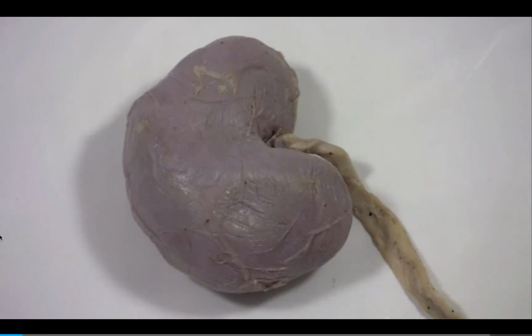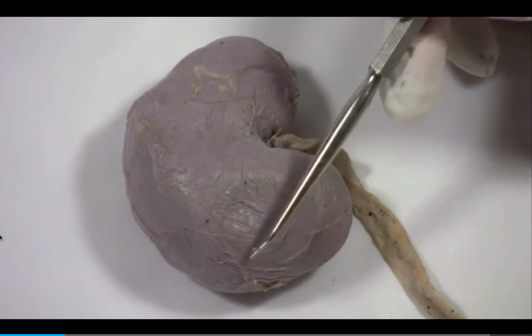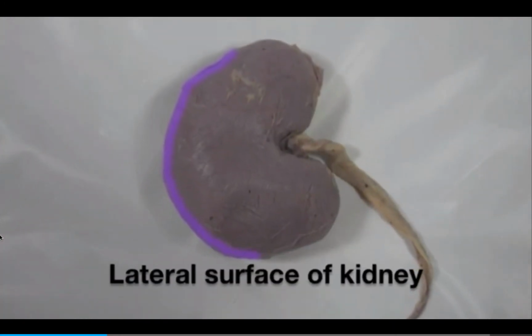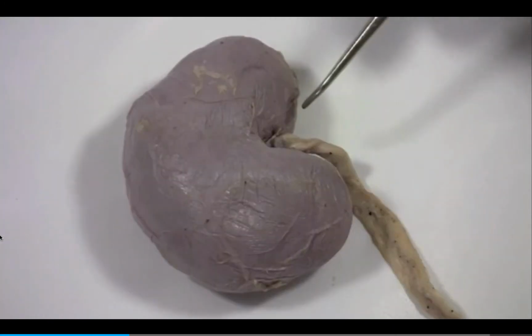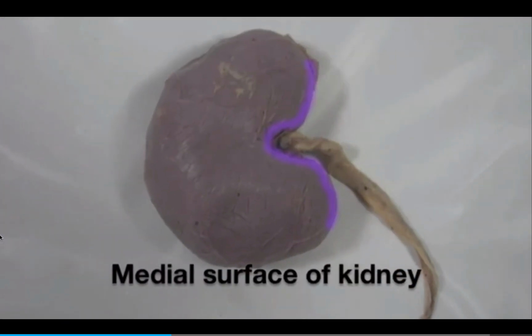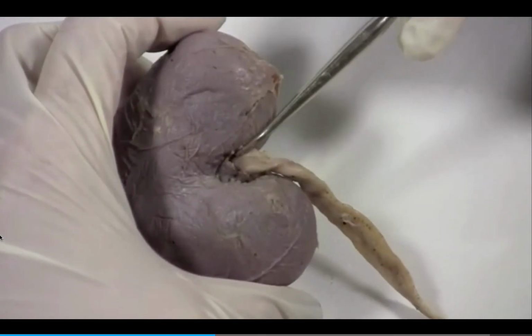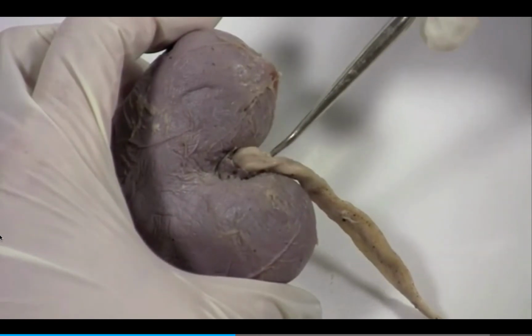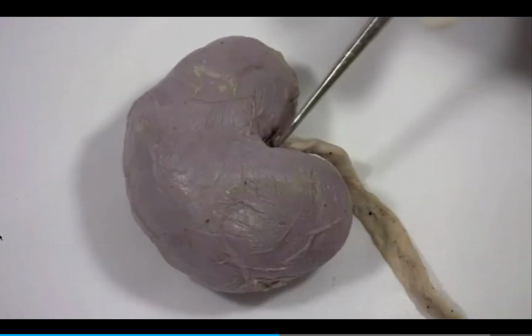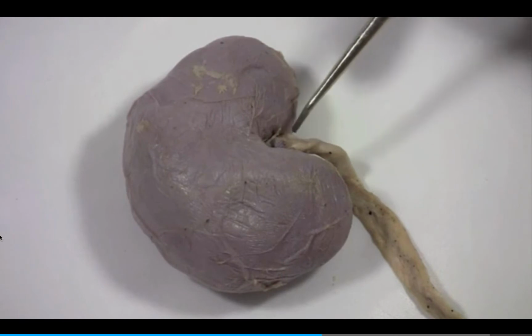Let's take a look at a whole sheep kidney. You can see its characteristic shape, the convex lateral surface, and the concave medial surface. This medial surface contains an indentation called the hilum. This is where the ureter exits, and it's also where the blood vessels, nerves, and lymphatics all penetrate the kidney.